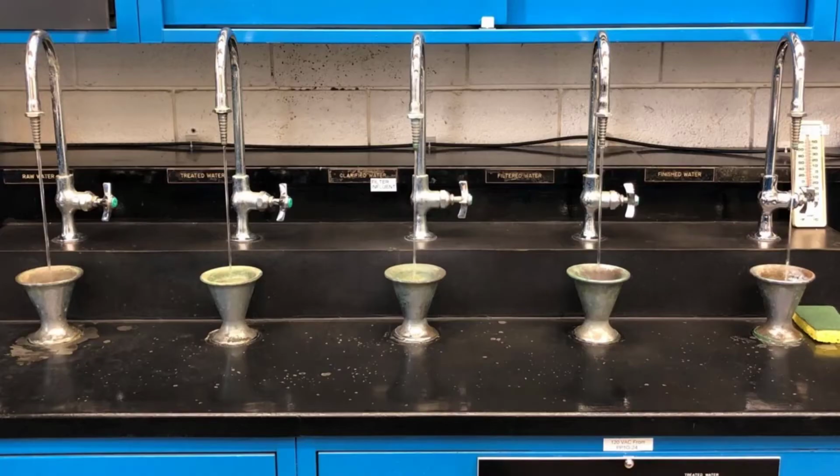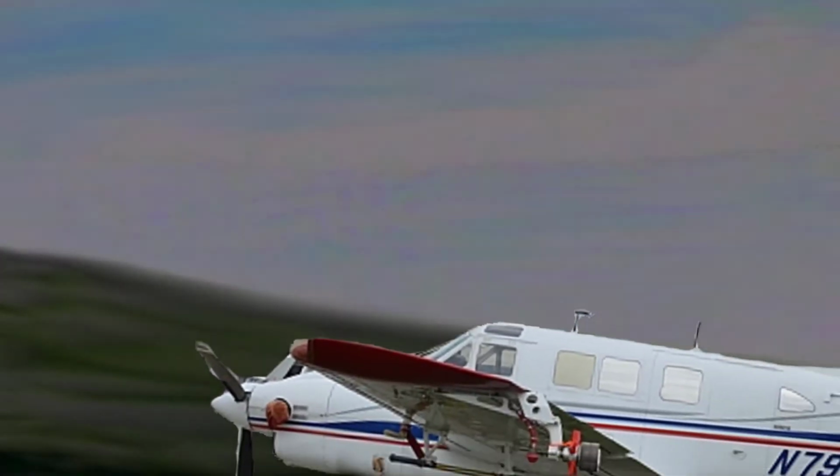Day 1 will be a sample set collected from raw and finished sample taps on the morning after a spray event in the vicinity of a particular PWS reservoir.